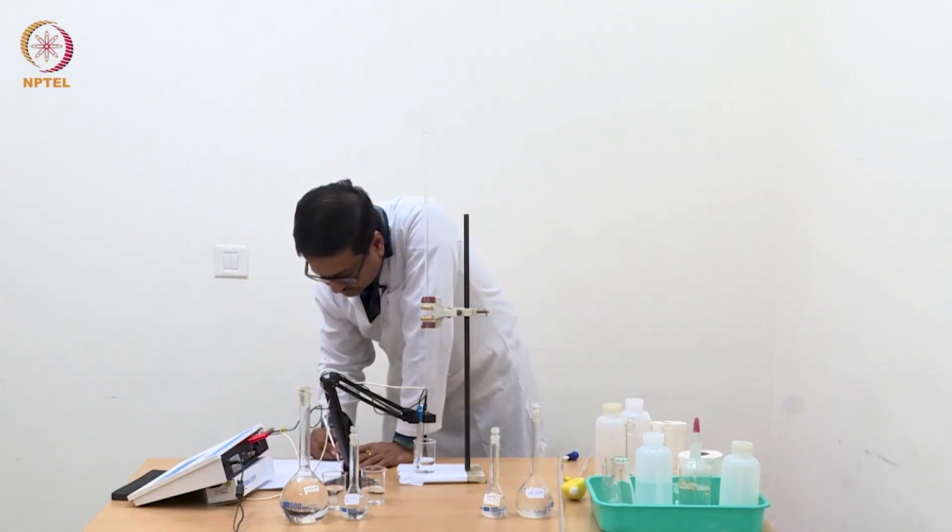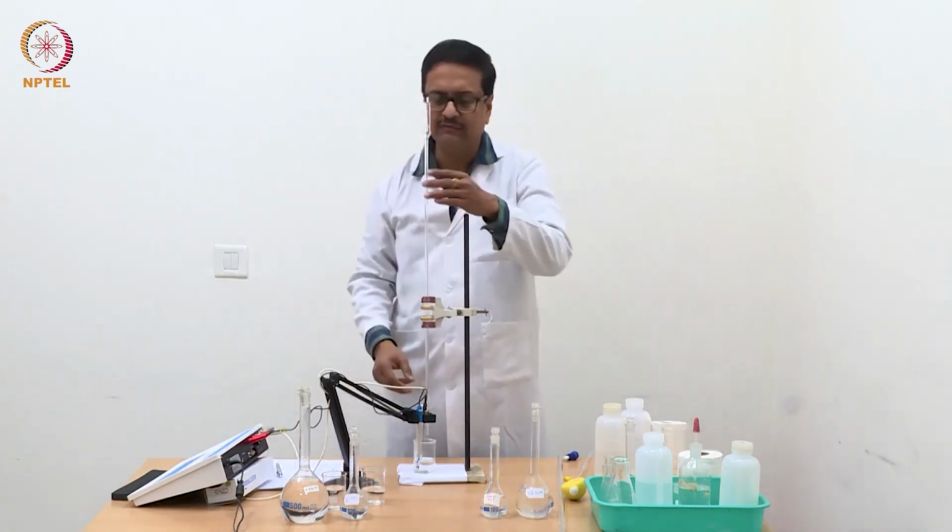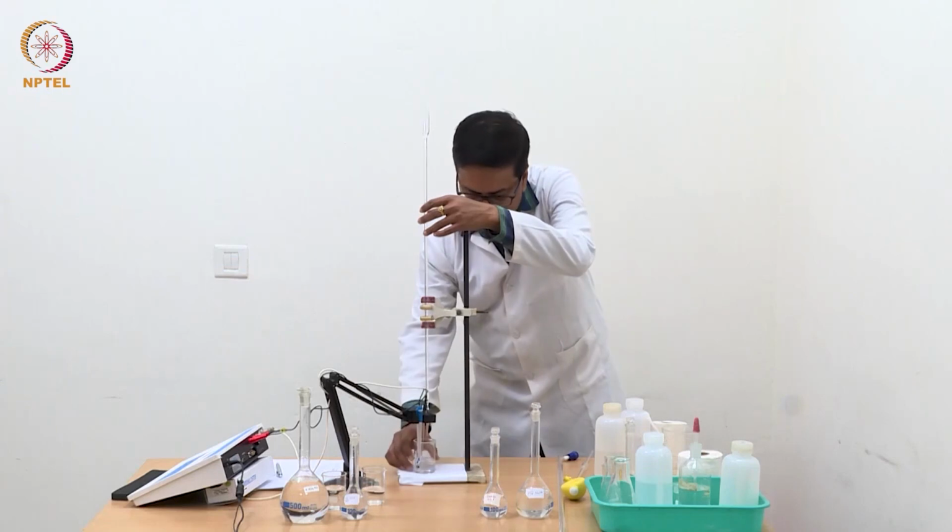We will take two more readings at 1.8, 1.9, maybe up to 2 ml. 3 readings will be sufficient.